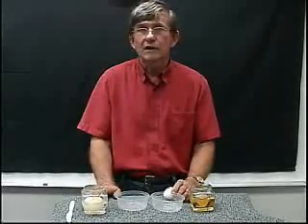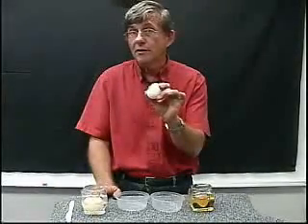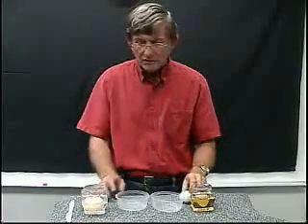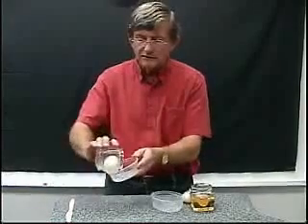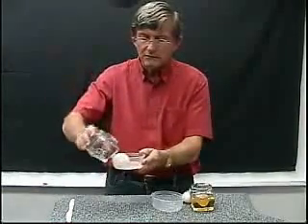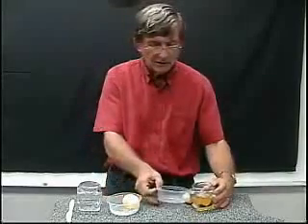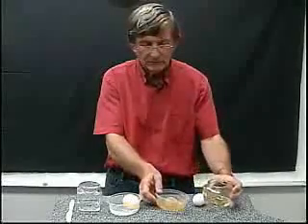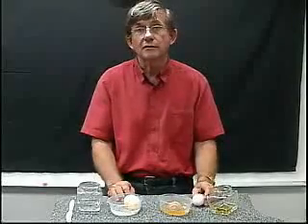Mrs. Del Campo got our experiment started, and now it's time to take a look at what's actually happened. As a point of reference, we're going to use a chicken egg like the one we started with, and we'll come back and look at this closer in just a moment. But what we're going to do first is take the two containers where we had our eggs previous from the experiment and move them out. We will have one egg that's been in plain water, and we have one egg that was in corn syrup. And now we'll take a closer look at them and make a comparison.